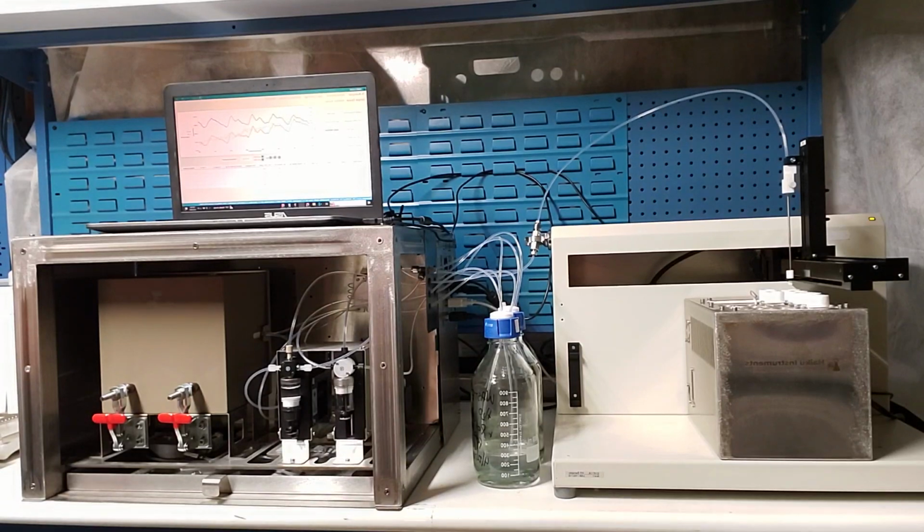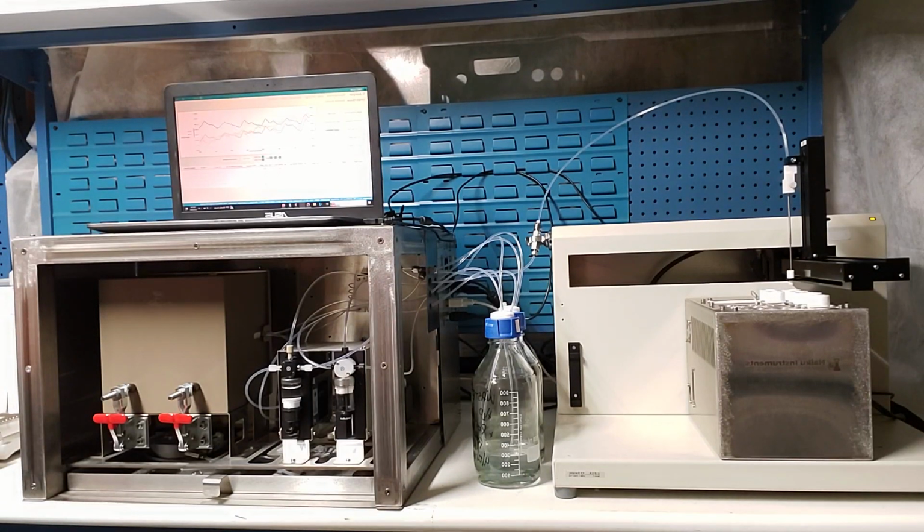After the sample has been loaded, there's a short equilibration time, after which the sample is injected, and we go from a baseline measurement of solvent viscosity versus solvent viscosity. So we're getting an instrument constant. Then the sample is injected, and we go up to a plateau, and that's the relative measurement. With the relative viscosity and the sample concentration, we can use the right physical chemistry equations to get the intrinsic viscosity.